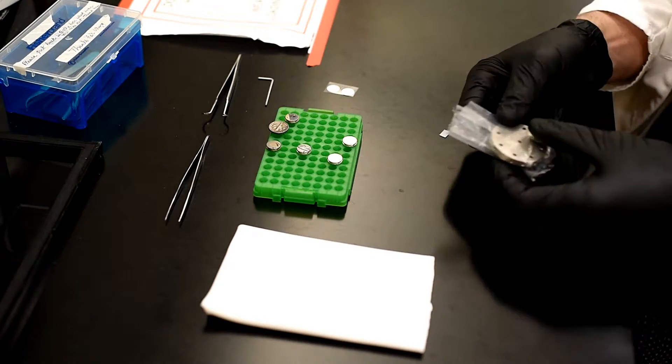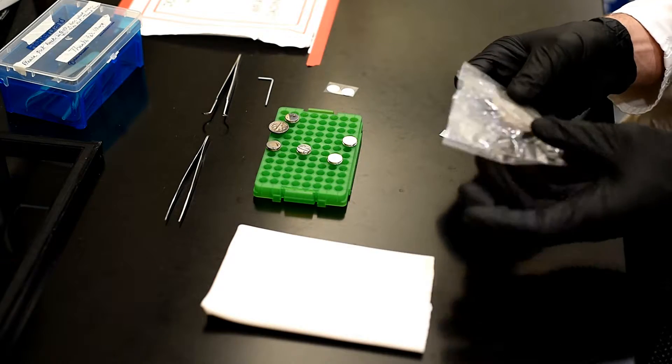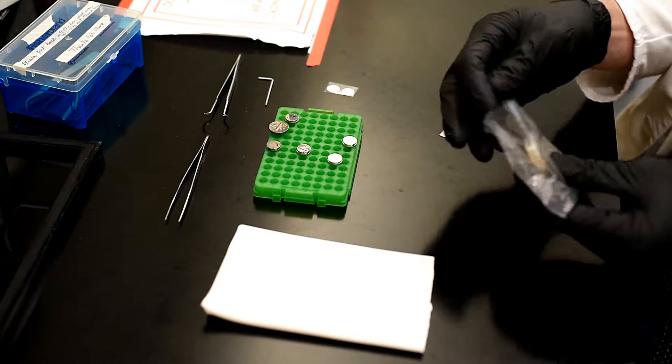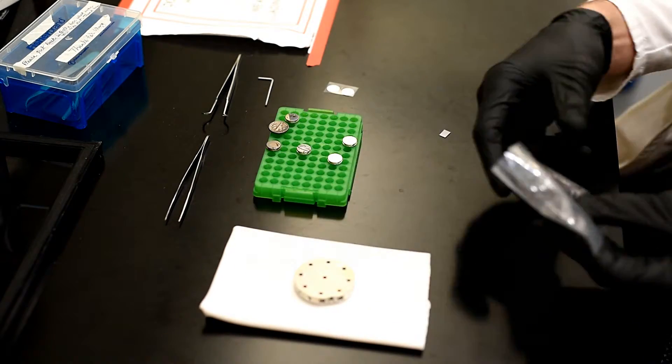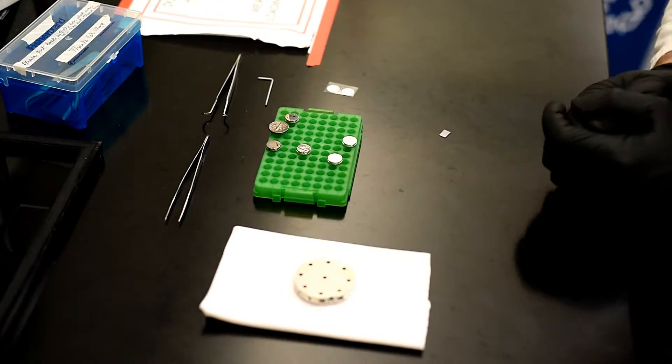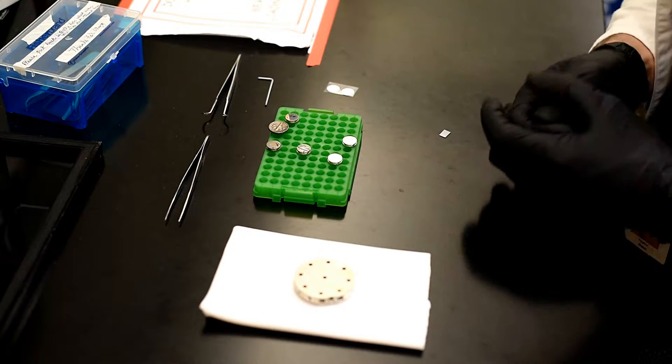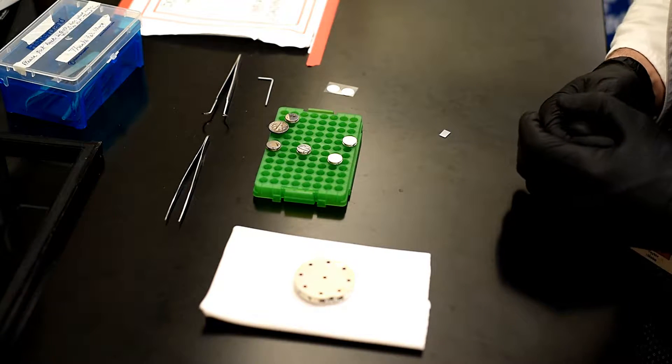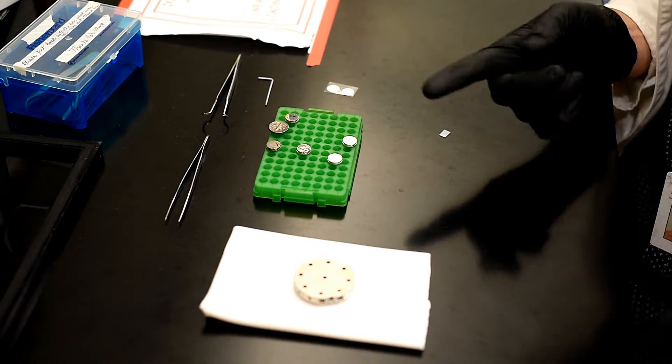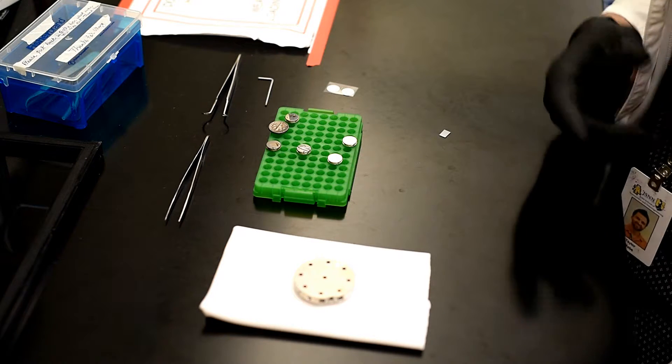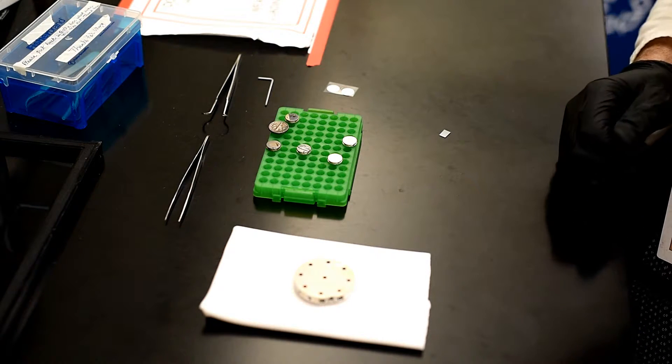There's a box that we use that has tools and tweezers in it. We keep the sample holder in these plastic bags and the use of gloves to minimize the fingerprint oil. And I have here an array of different samples. Most of them are already metallic or already have a metallic coating on them via the sputter coater.